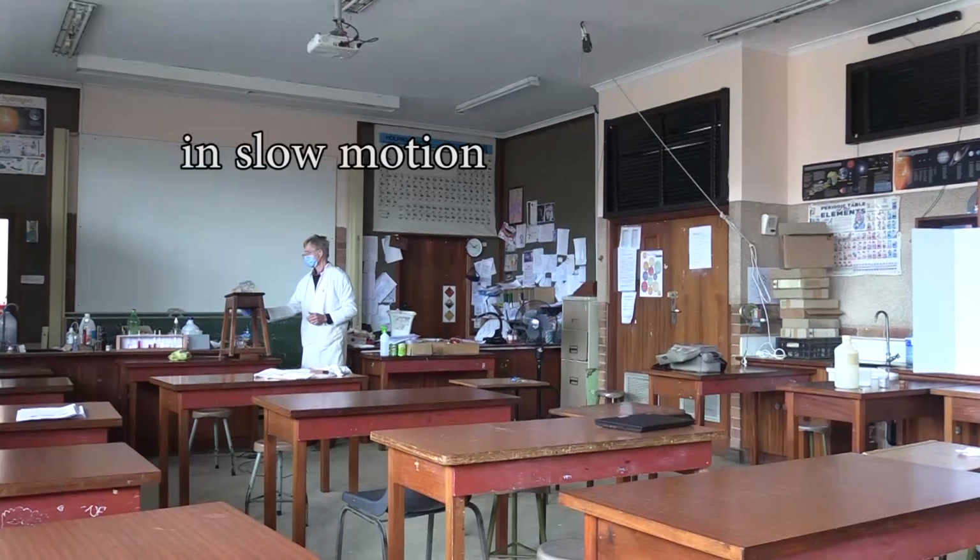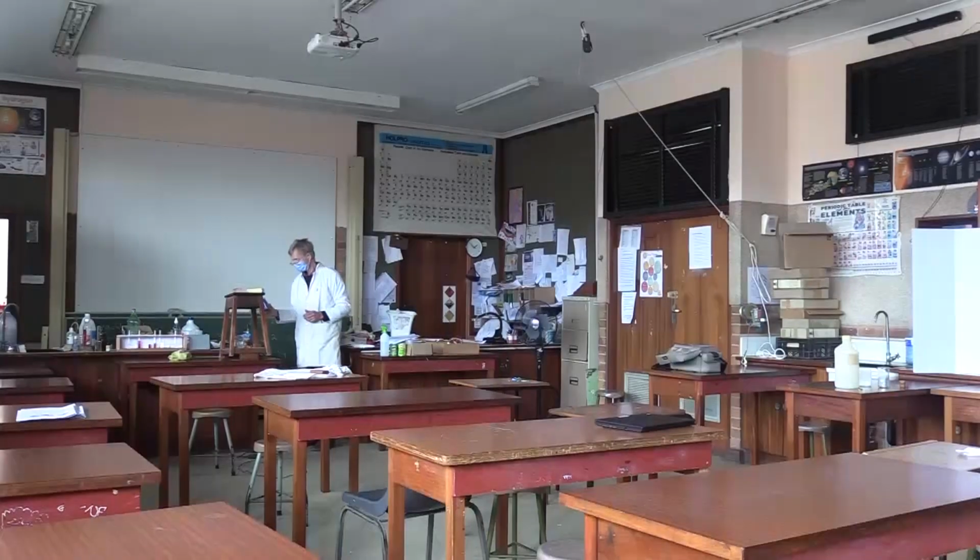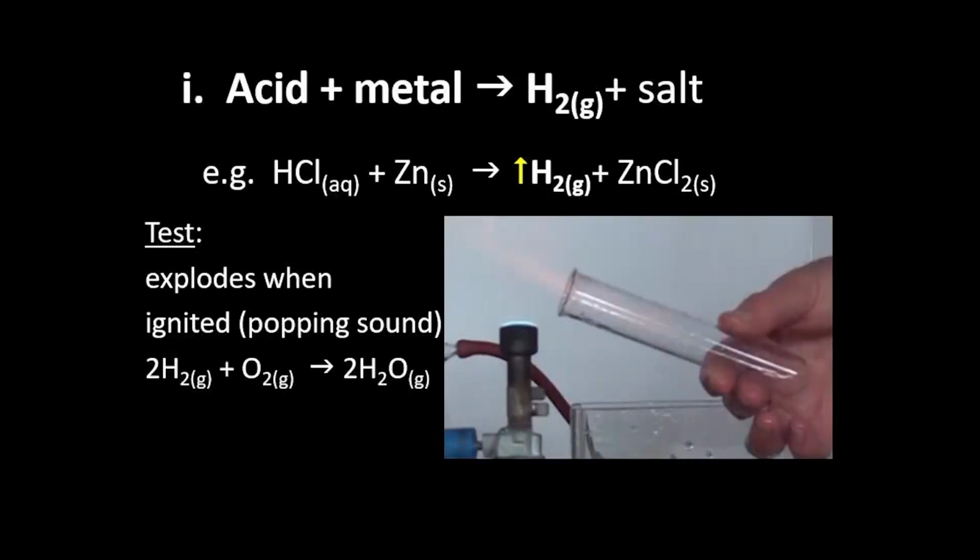Let's watch that in slow motion again. That's real rocket fuel, a 2-to-1 mix of hydrogen to oxygen. So we've just seen the hydrochloric acid and zinc making the hydrogen gas, which bubbles off, and the salt zinc chloride. And then to test for the hydrogen, we exploded it, and it makes water.